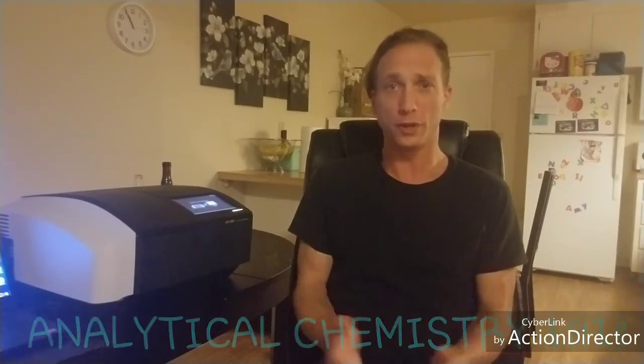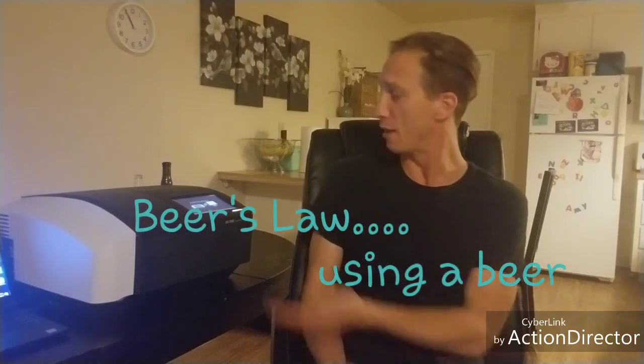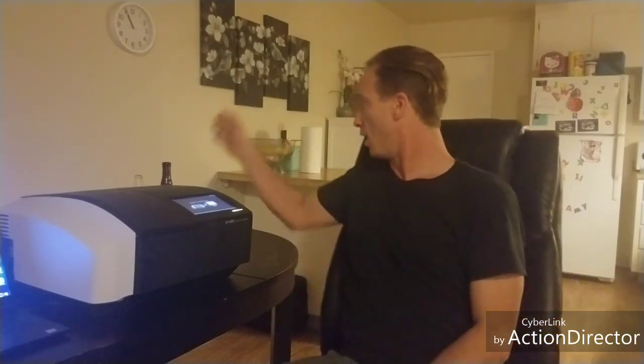Hey guys, Drew here. Taking a break from playing music tonight because I have the new Shimadzu UV1900 here and I'm playing around with it and thought you guys might be interested in seeing a little bit about what a spectrophotometer is and what it does, and explain to you a little bit about Beer's Law if you don't know what it is, because it's something nobody's really going to teach you unless you go to school for it, and it really is kind of a fundamental concept to understanding the world around you that I think everybody should really know. So I'm going to show you Beer's Law tonight on this UV using a beer.